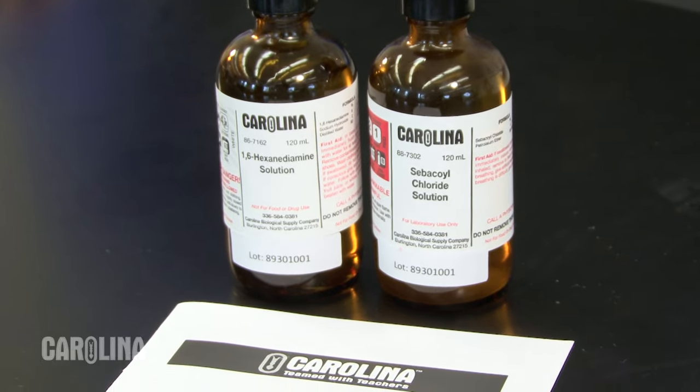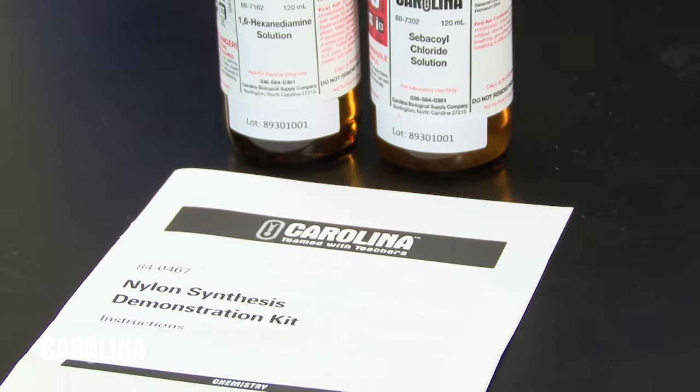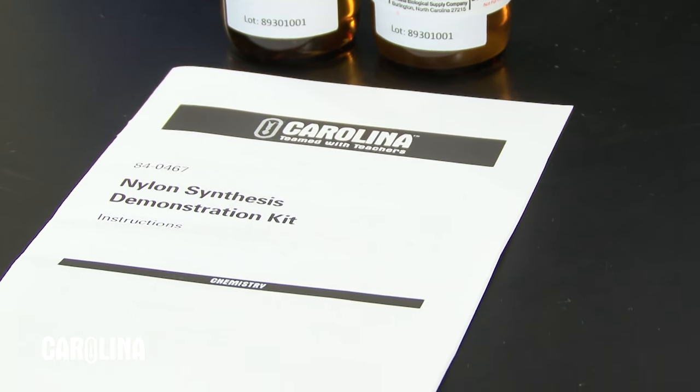Hi, I'm Jared Hyman, an assistant professor of chemistry at Elon University. Today I'll be performing a demonstration from the Nylon Synthesis Chemistry Kit from Carolina Biological Supply Company.